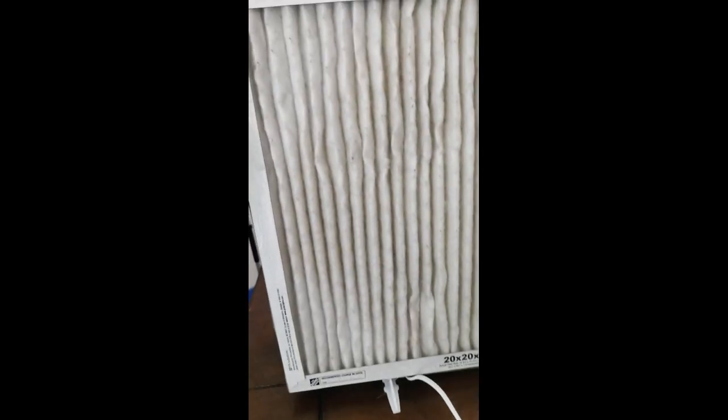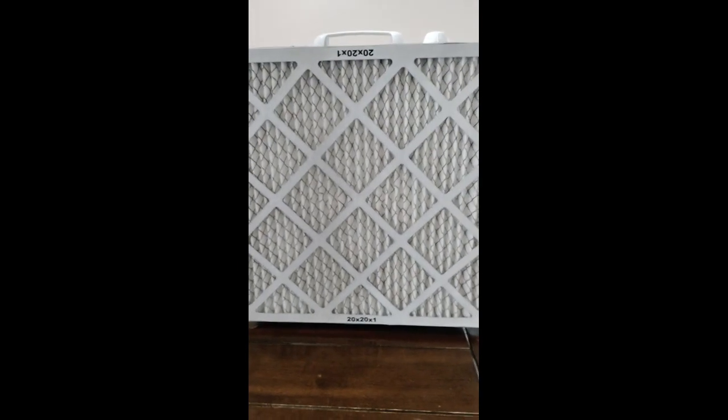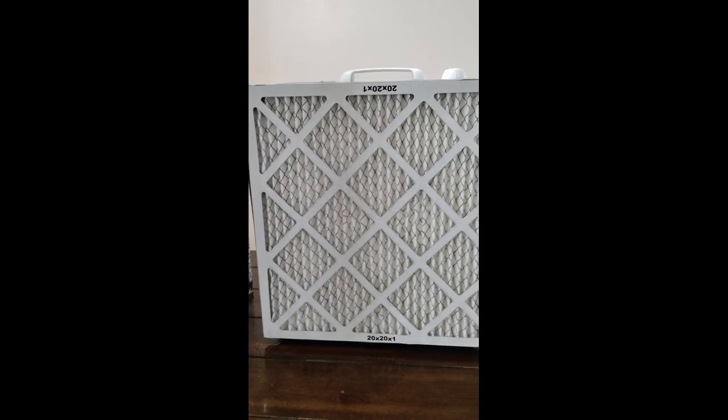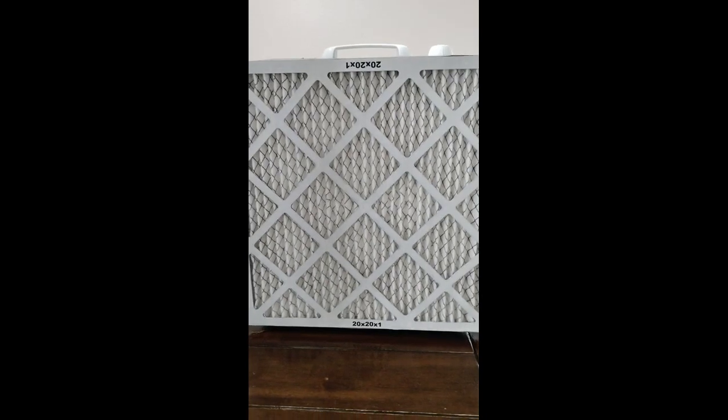Don't be afraid, it's not going to hurt it any. Then you let it sit for approximately five minutes, and then turn the fan on and let it run for 30 minutes to filter the air in the room before you get started.